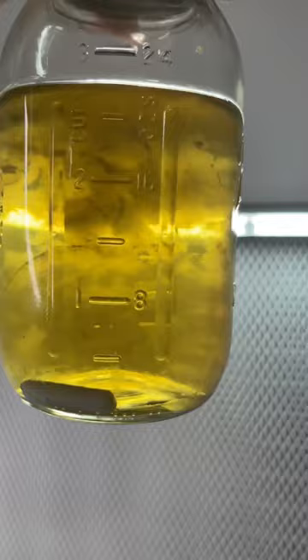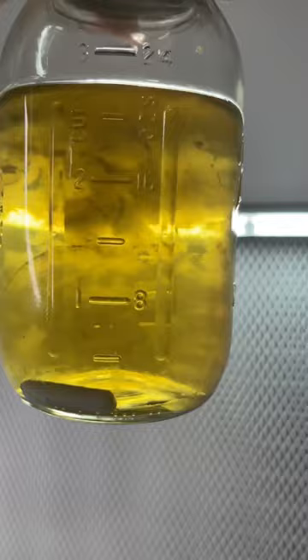A magnetic stir bar helps to break up the mycelium as it grows over the next few months. This liquid culture can now be made into syringes or stored for years.